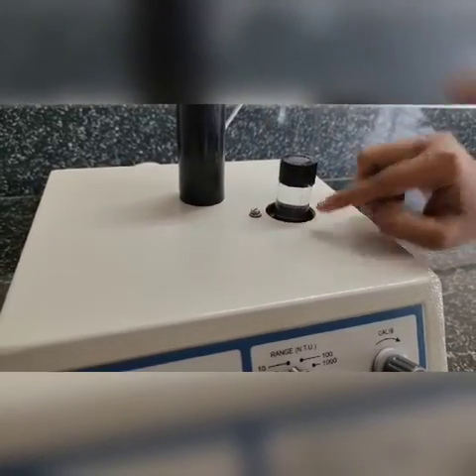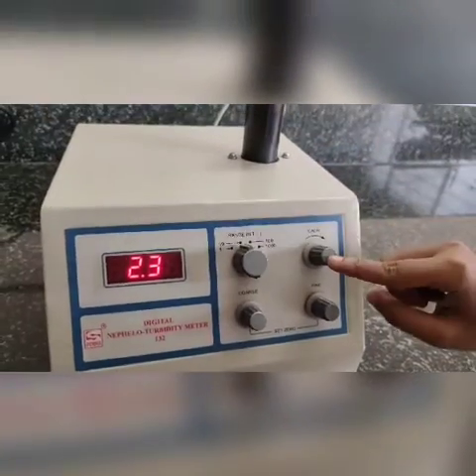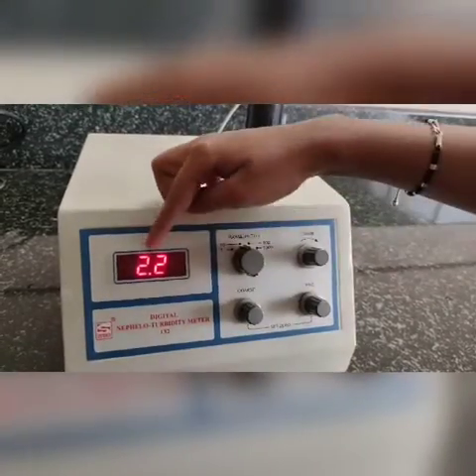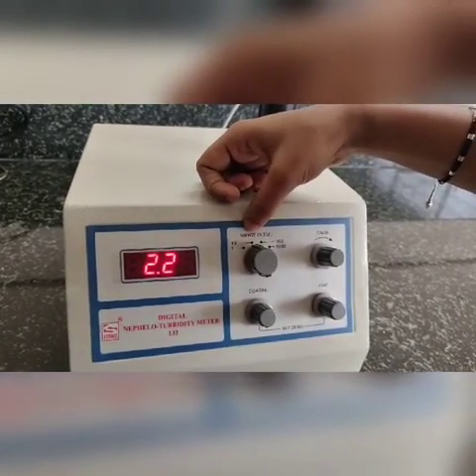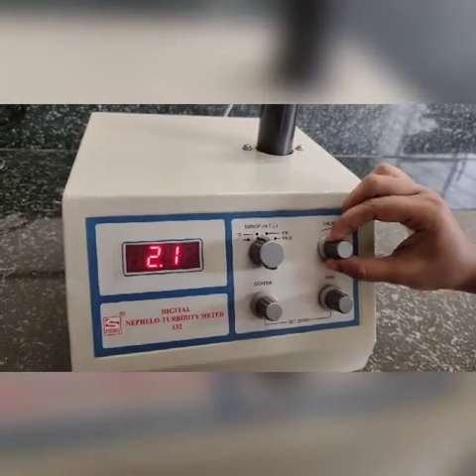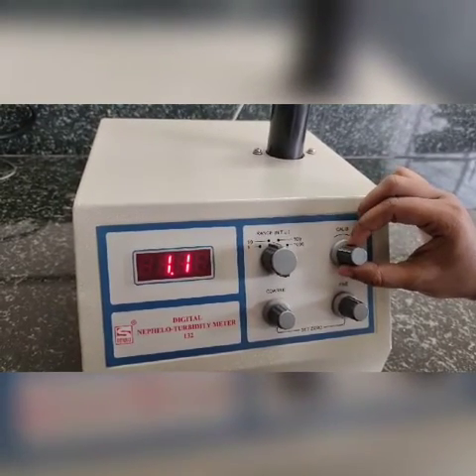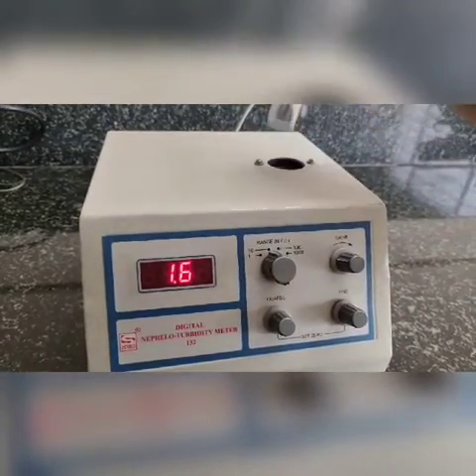Close the lid. The calibration knob should be at maximum — rotate it in the clockwise direction. Set the range to 10 when using 1 NTU and 10 NTU solutions. Now adjust the calibration knob so that the display reads 1.